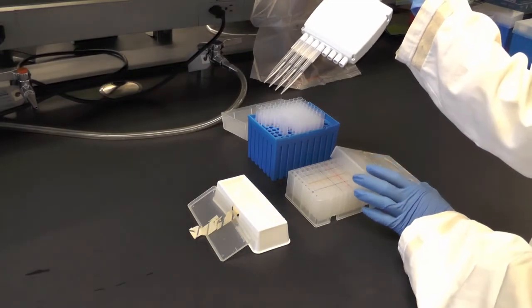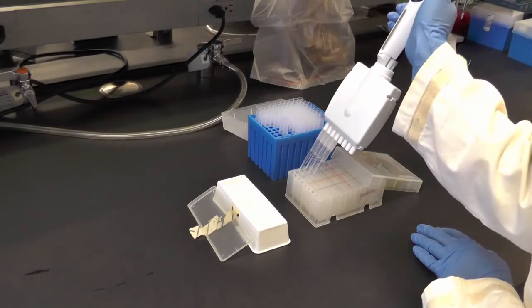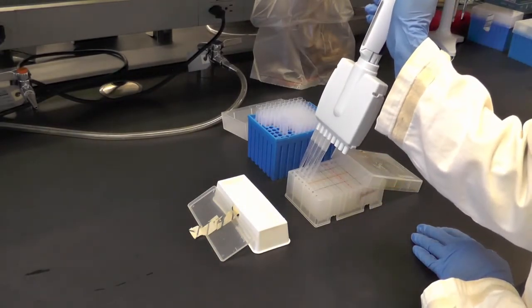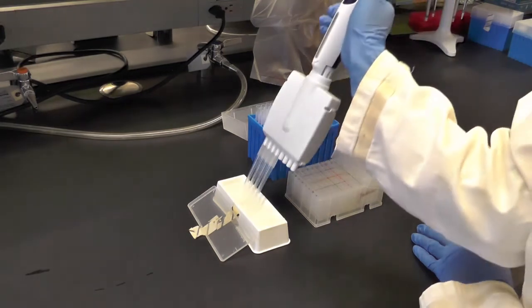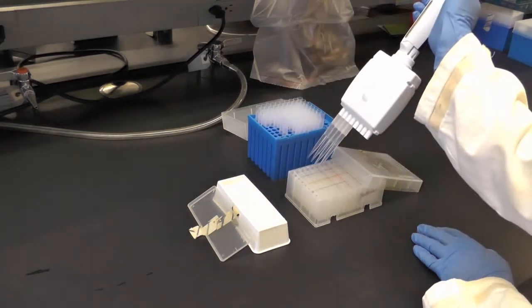Then insert tips into the wells of the megablock where you want to transfer the liquid to and dispense. Repeat this step to fill all the wells you need for your dilution preparation.